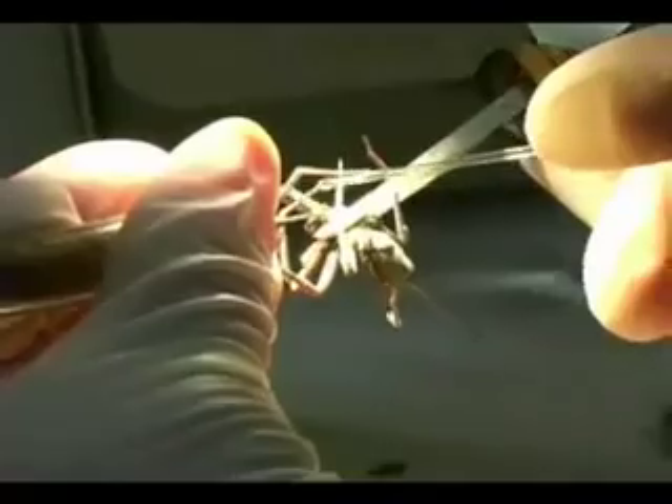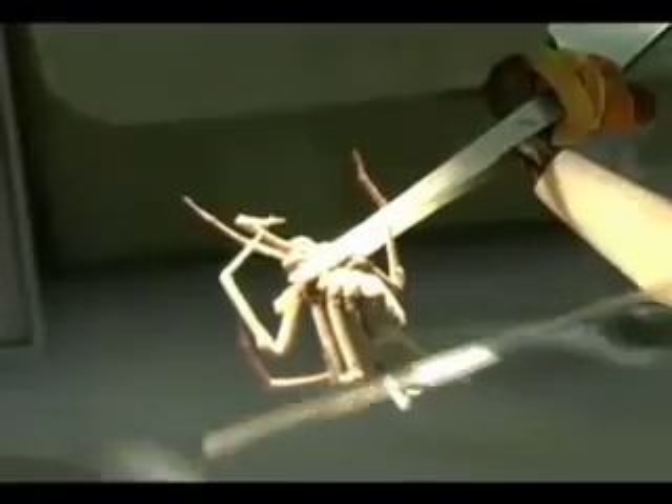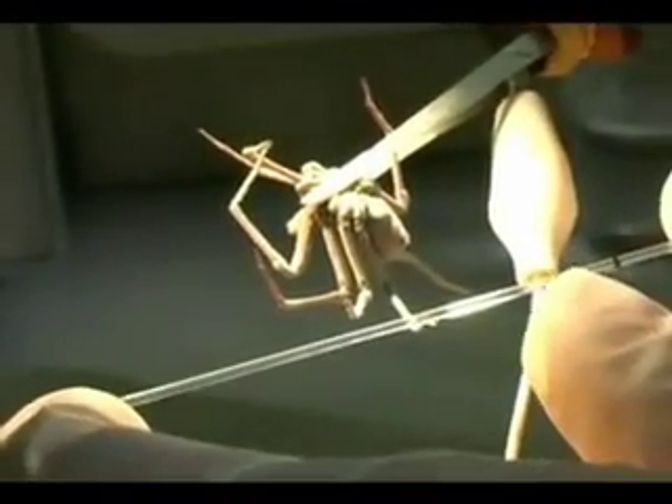And if all works well, you'll see the venom going straight into that tube. I don't know if you can see that, but there's a lot of venom going into that glass capillary tube. Wow, that's a lot of venom — you can see all of that is venom that came out of that spider.